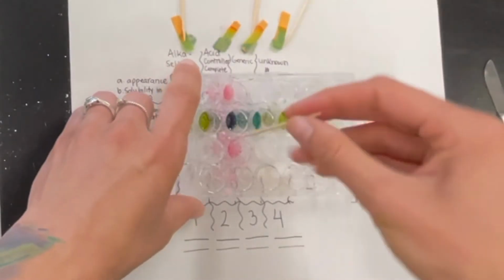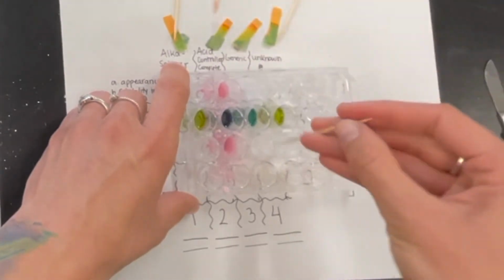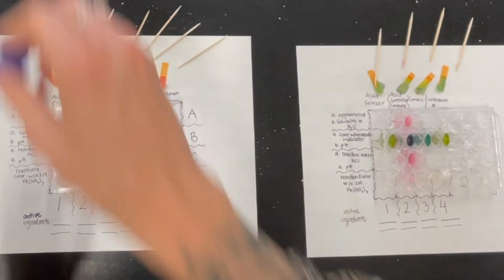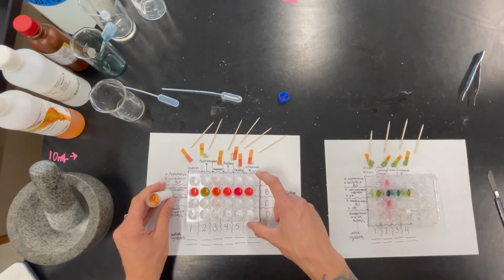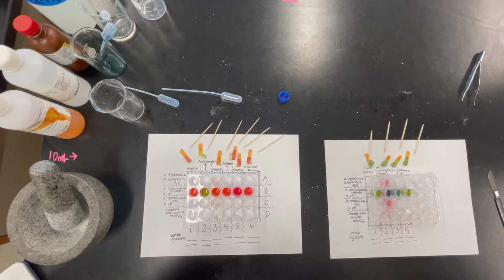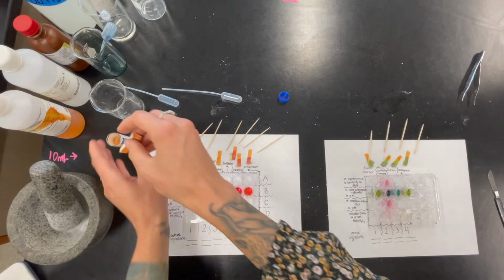Man, that Alka-Seltzer really just disappears, doesn't it? This Acid Controller Complete also looks like it's dissolving much faster than it did in the deionized water. Perfect. So now we're going to do a pH test of all of that as well. And what we want to look for while we're doing this is also color change over time in these wells too, which is nice about having this as a recording. We can rewind and go back to the before and the after. So let me get some strips for us to do a pH test with.